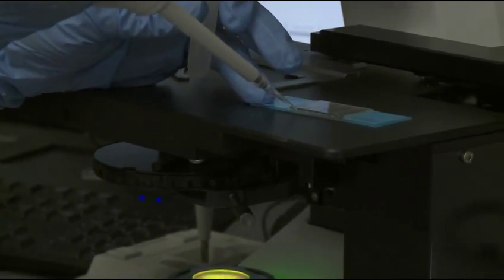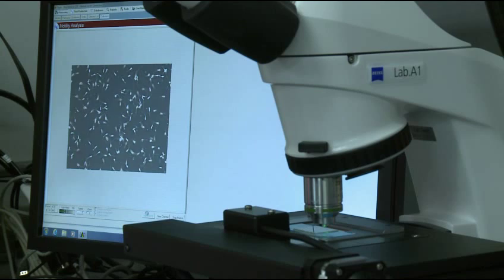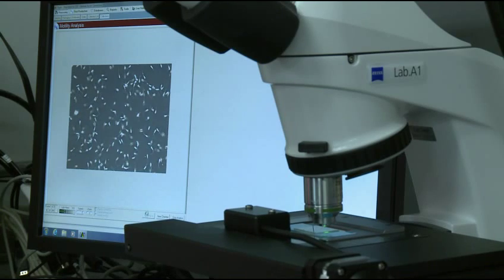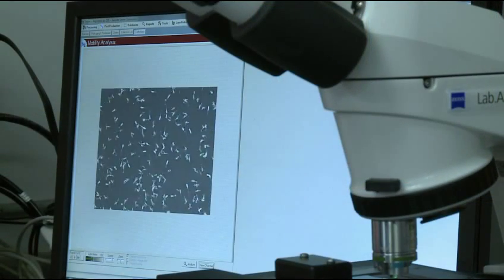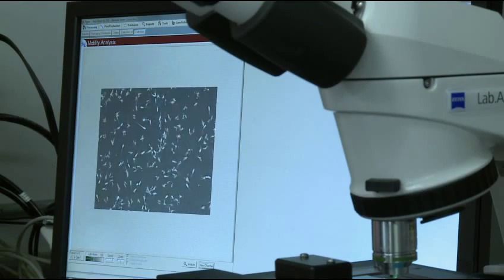Because our first priority is your success as a breeder and commercial producer, we urge you to follow these instructions carefully and fully to safely thaw frozen semen and to prepare the proper dose to ensure a maximum success rate.